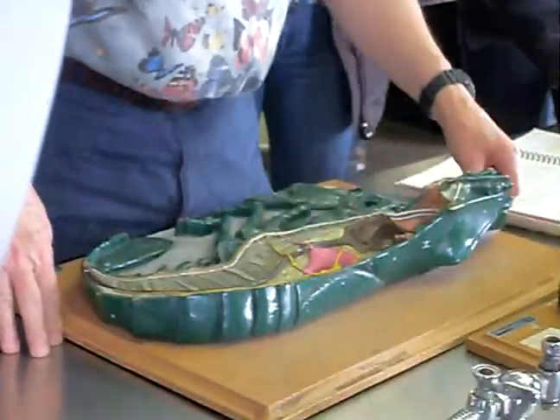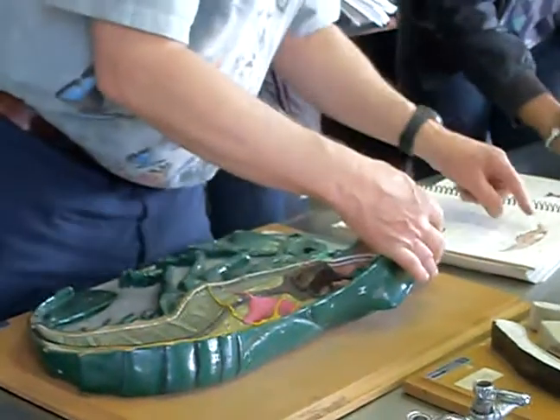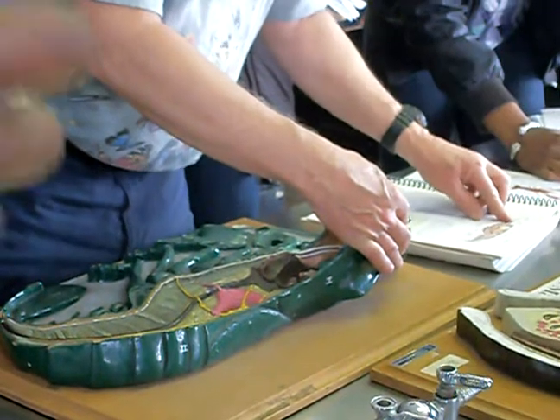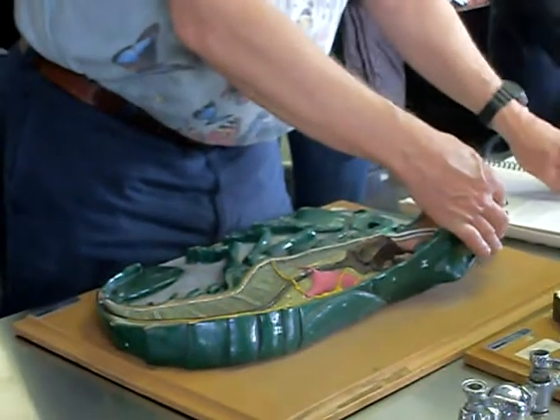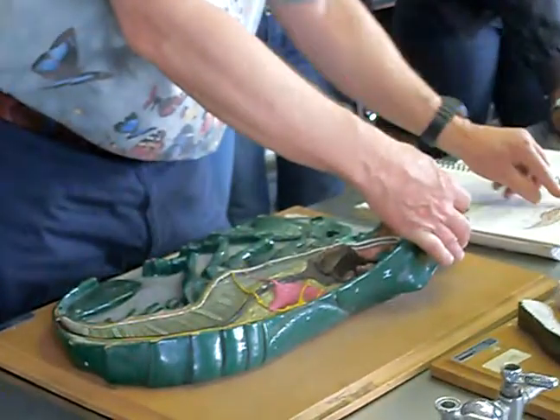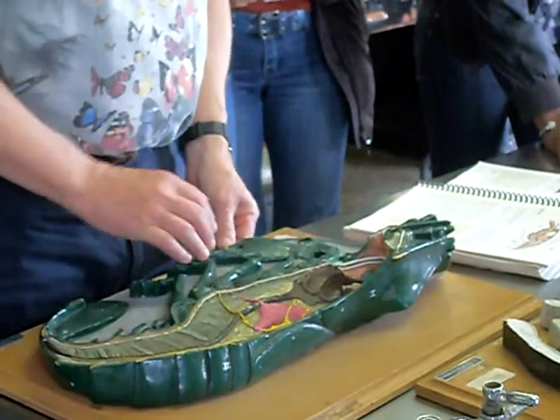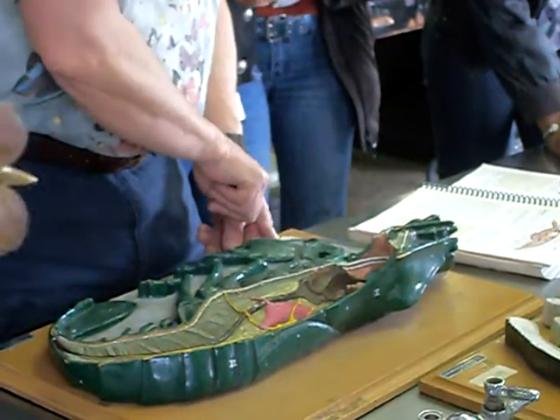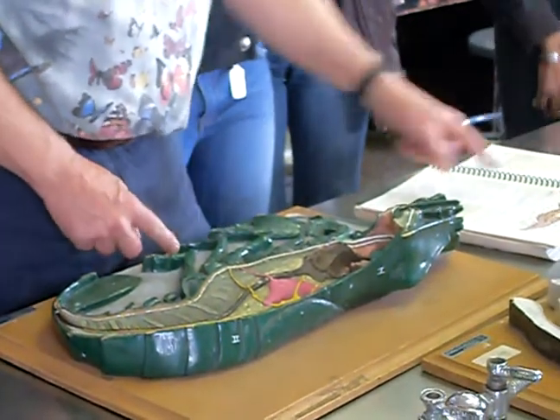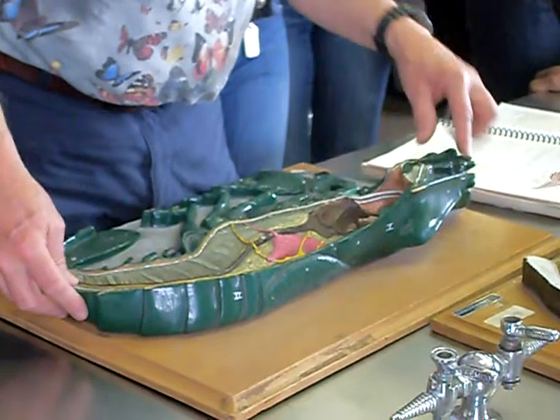We have two pairs of antennae. We have two little ones that have been cut off here, called first antennae or antennules — they're labeled the same thing, either first antennae or antennules. They're smaller, short antennae that would have gone out about this far, as shown in the picture. Then the second antennae — or if you use antennules, then this would simply be the antennae — and they're much longer, going all the way back to about here. So you can see the two sensory structures: short ones and long ones.